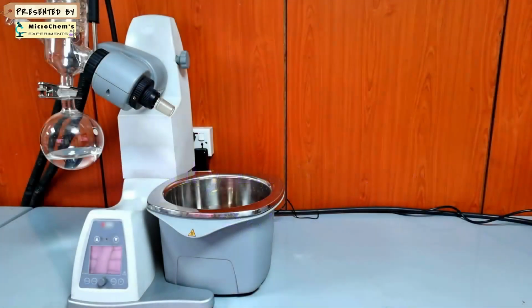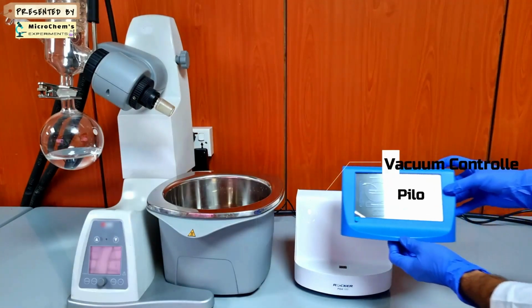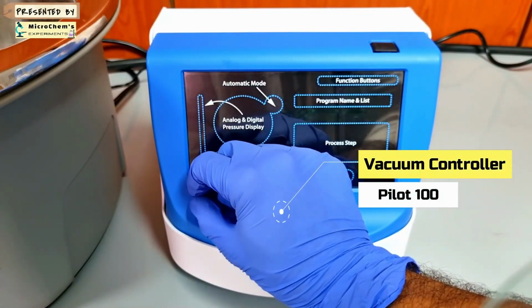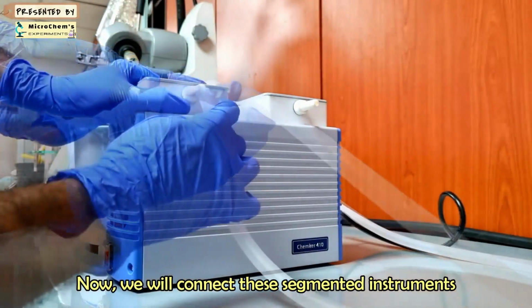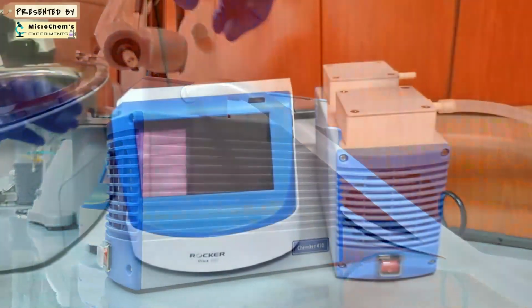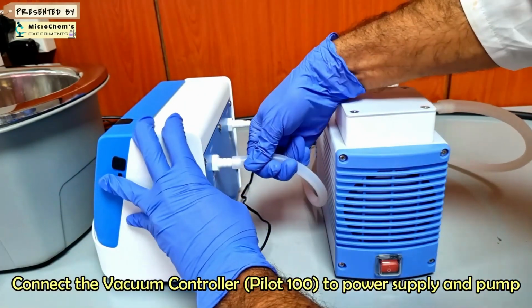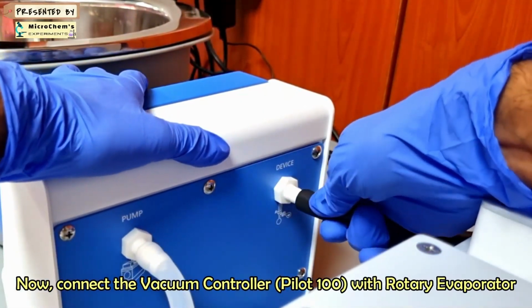Let's prepare the rotary evaporator for drying the extract. This is the vacuum controller, and this is the vacuum pump. We are connecting the pump with the controller unit. Now connect the rotary evaporator with the vacuum controller.